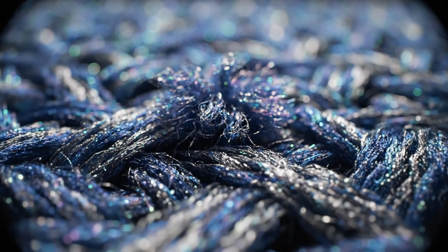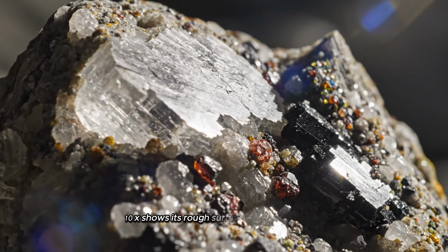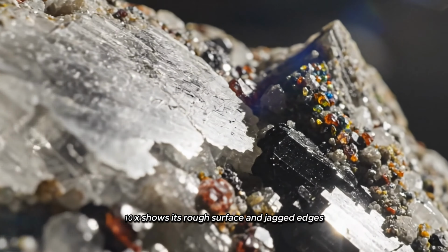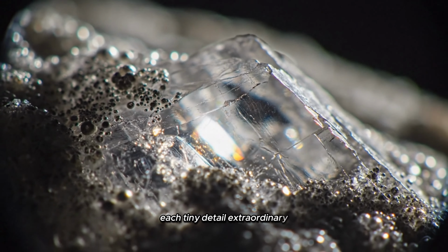A grain of sand might seem ordinary, but under the microscope, 10x shows its rough surface and jagged edges. 100x reveals hidden minerals and textures, and at 400x, it becomes an alien terrain, each tiny detail extraordinary.